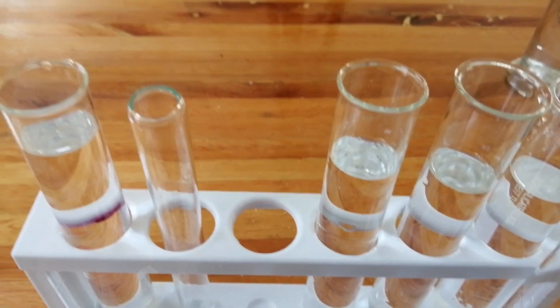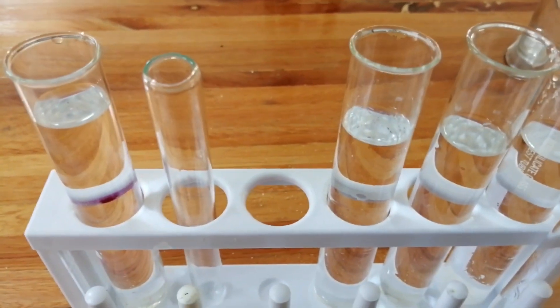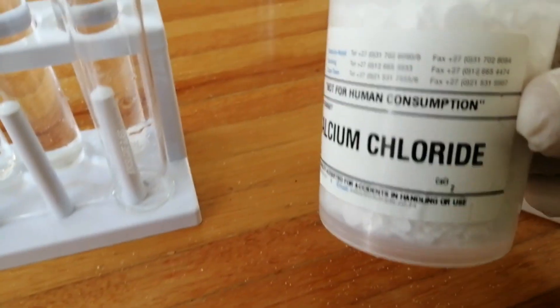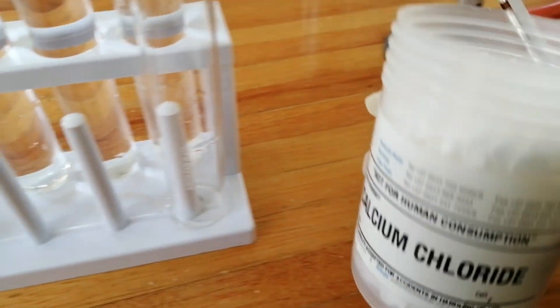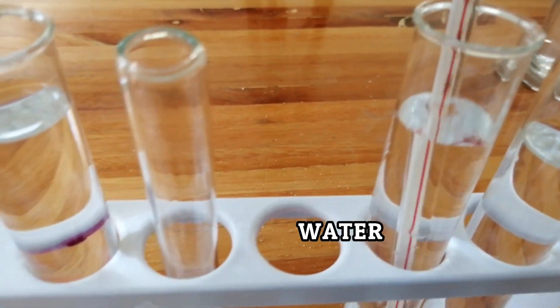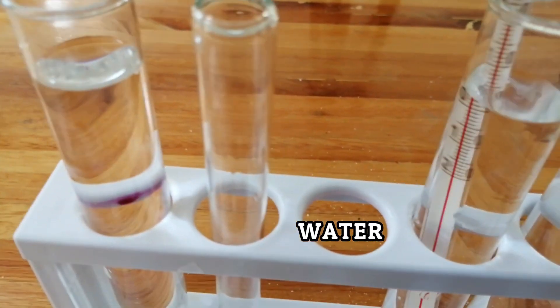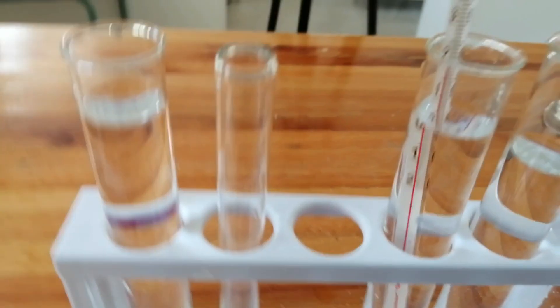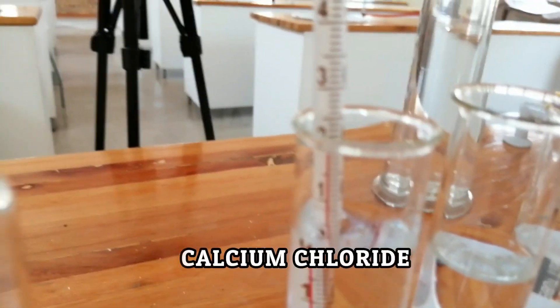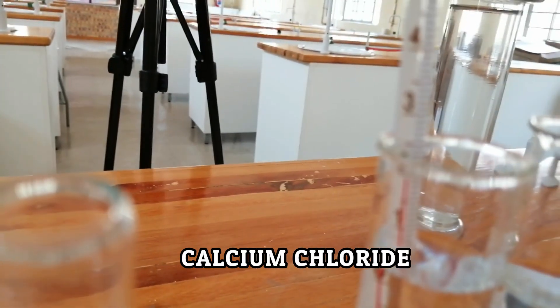Now let's see an exothermic reaction. The reaction we're going to watch here is the reaction between water and calcium chloride. Let's check the initial temperature of water — I immerse the thermometer as before. The temperature of the water is 20 degrees Celsius, you can see it here.